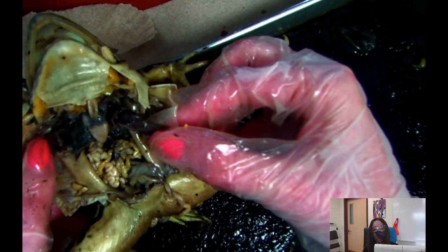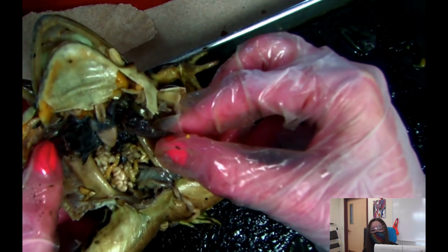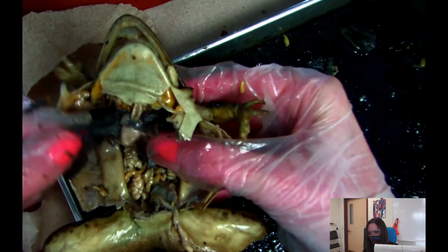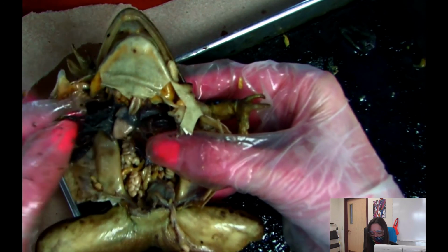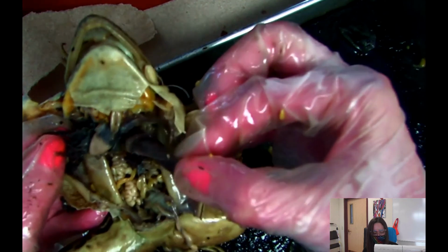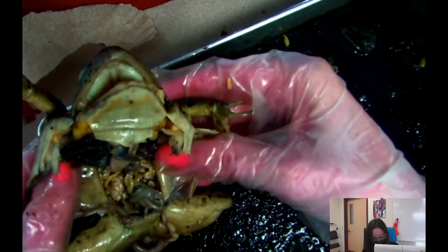And so I've actually dissected frogs where the lungs were filled with air, which was kind of interesting. And so you'll have the baggy-like structure on both sides. So there's one over here, and there's one over here. And we may give you some hints, and we may say like the baggy-like structures, whatever can help you. And then other than that, we're pretty much done with the frog.